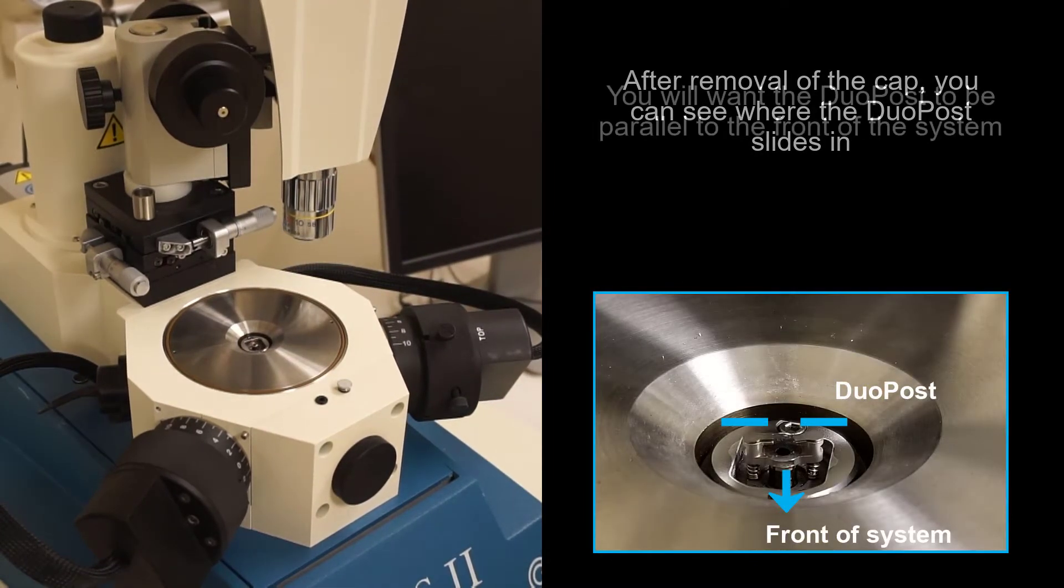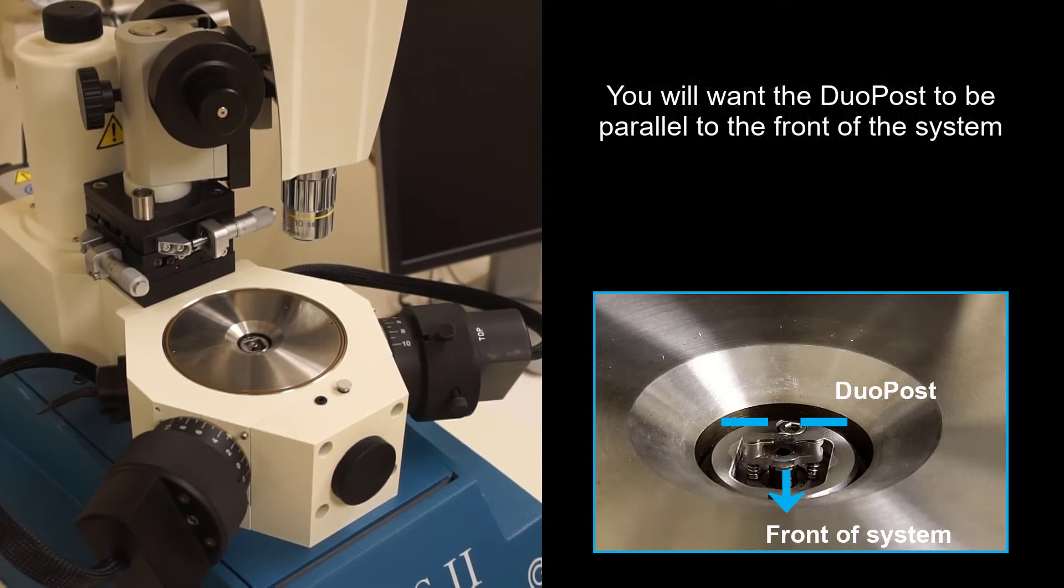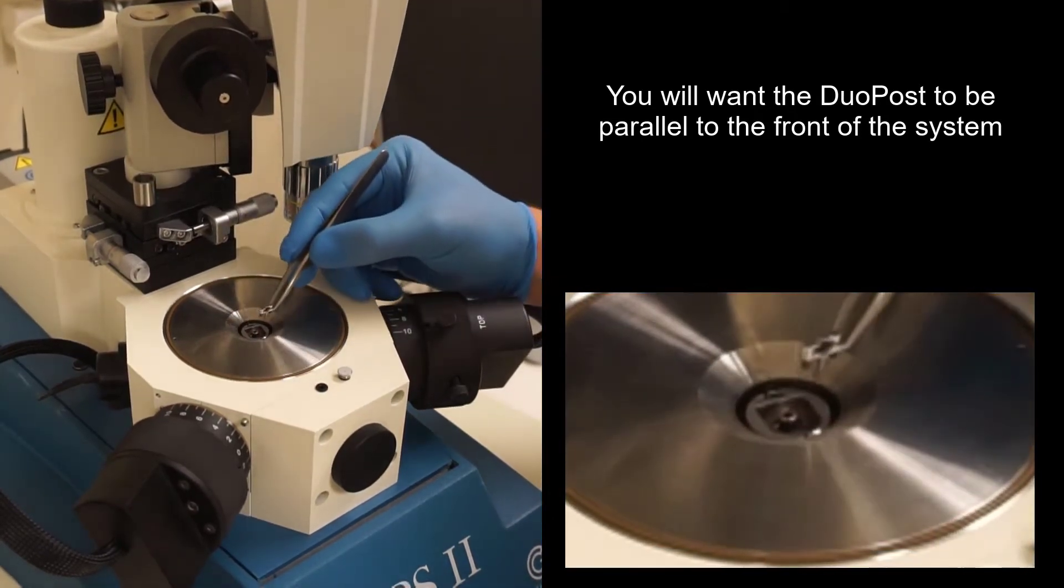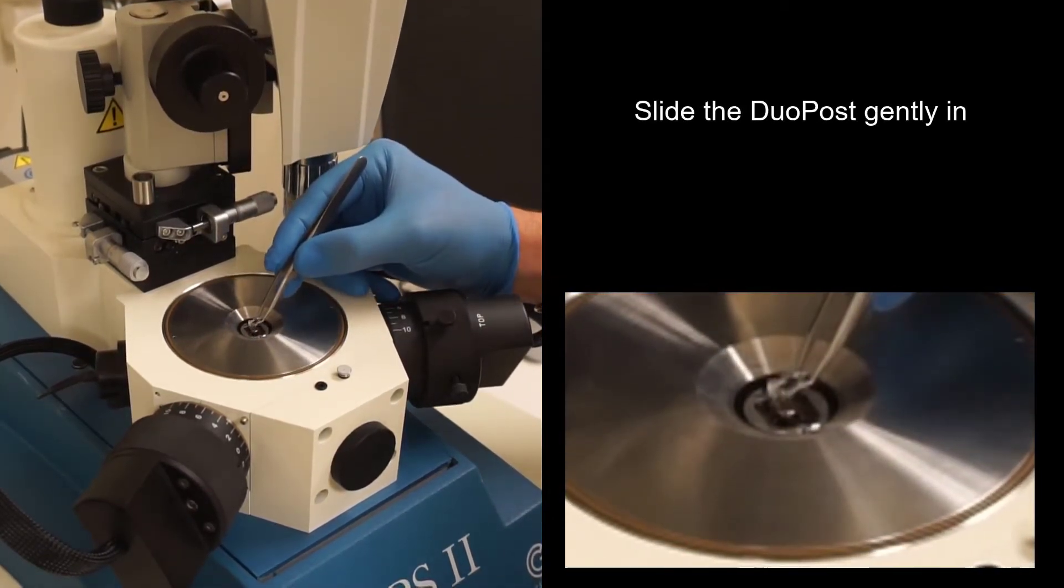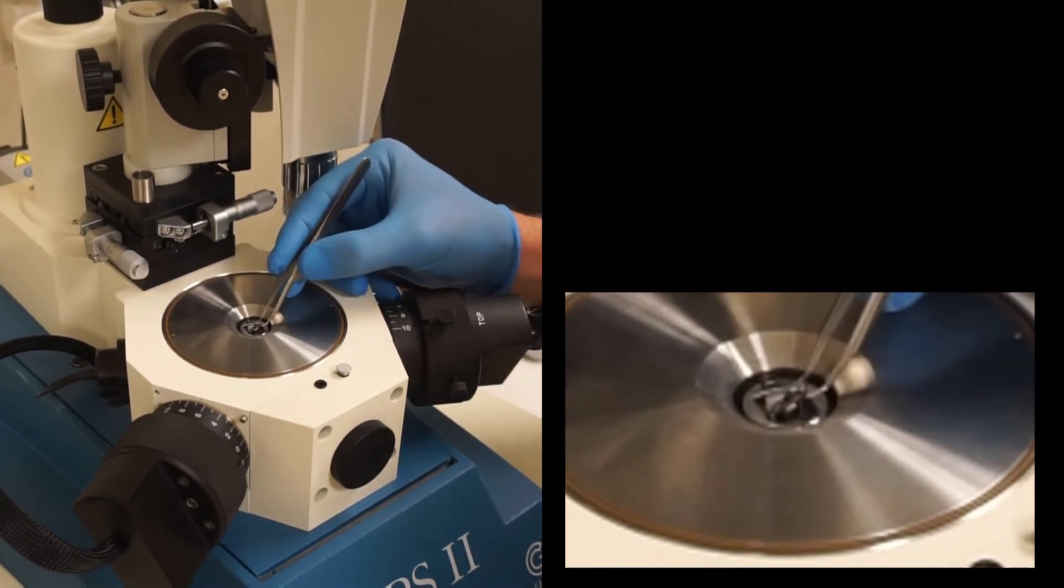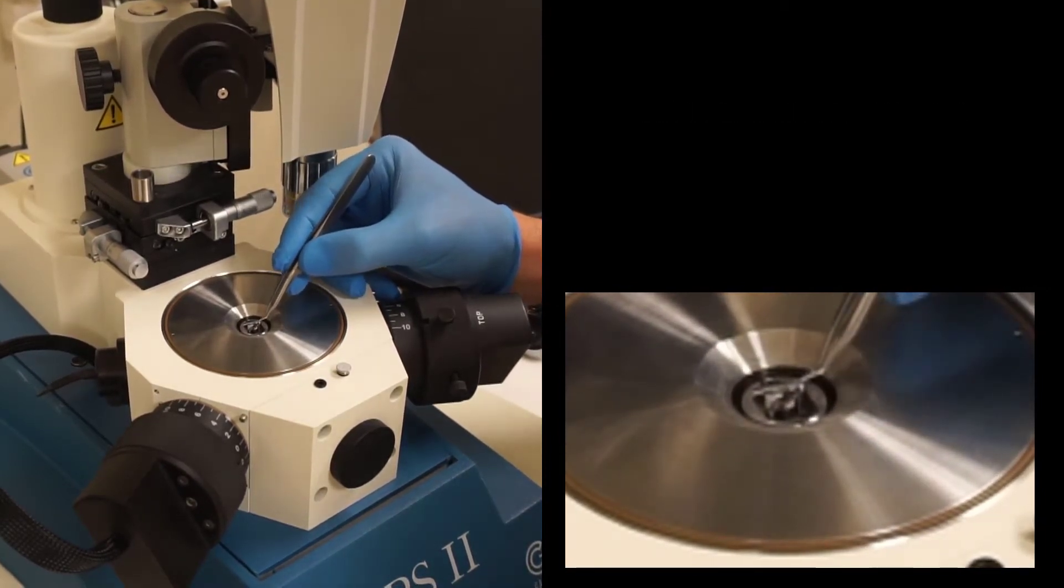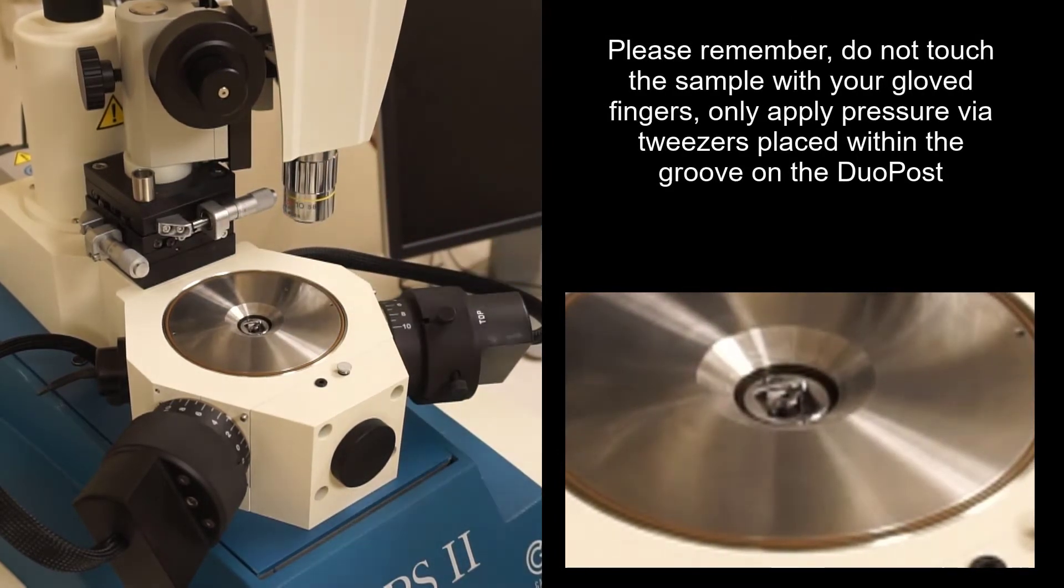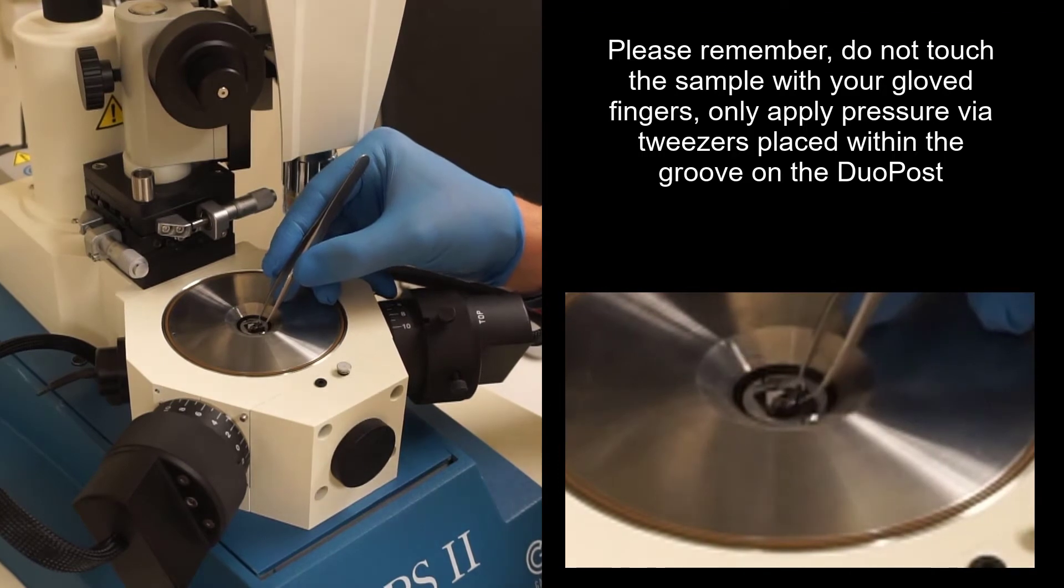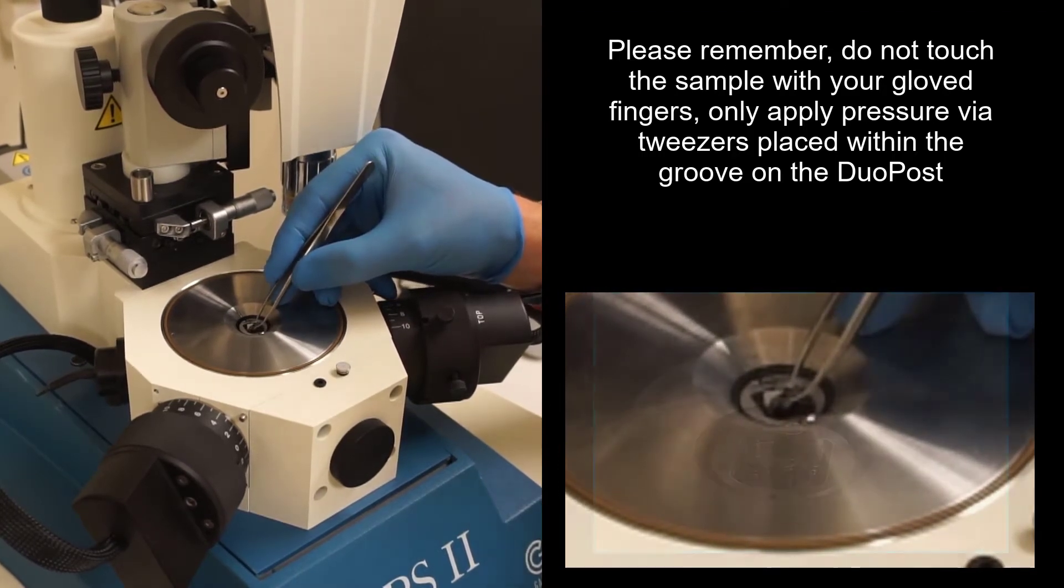You want the lamella fingers facing forward. Slide the sample gently into the mount and do not touch the sample with your fingers. Don't push down on it, just only apply force in the little groove spot for the tweezers.